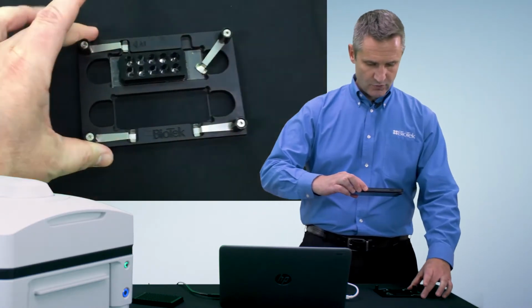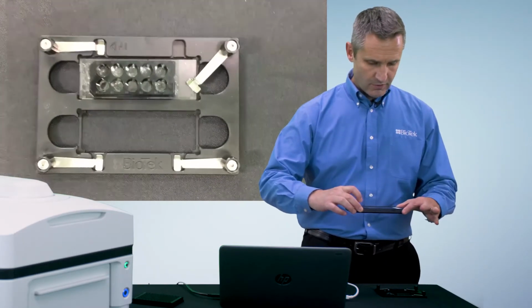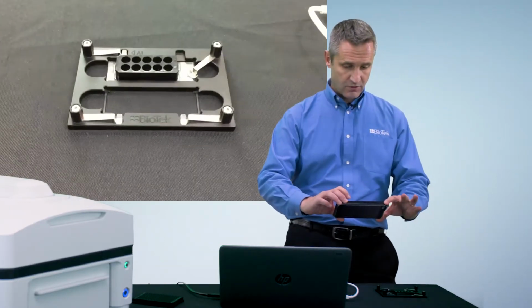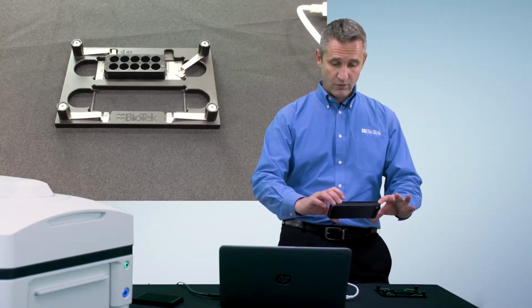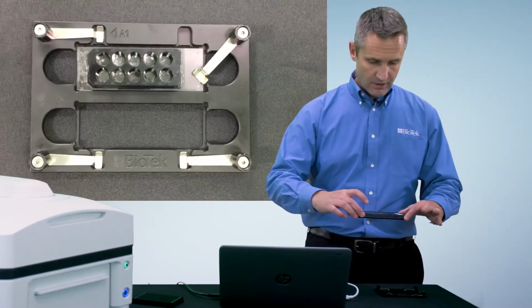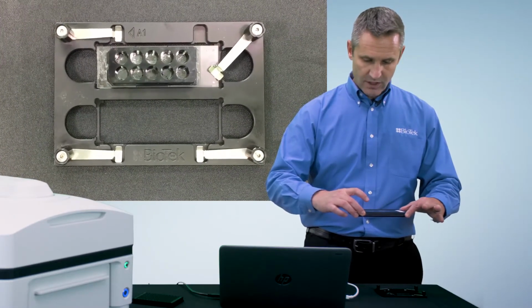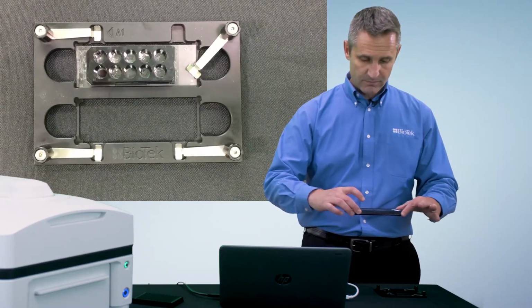and then take your picture while your phone or your device is exactly at the vertical of your labware. You do not want to take your picture at any kind of angle like what you see here. That would not work well for the definition. So make sure you're right above your labware in its adapter. One easy way to check that is to make sure that the sides of your adapter are well aligned and parallel to the side of your display on your phone.